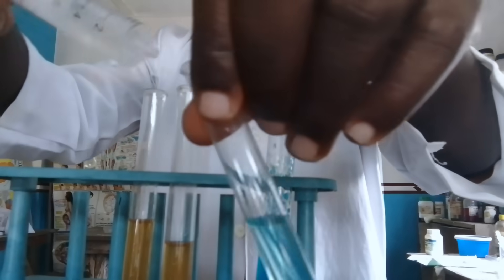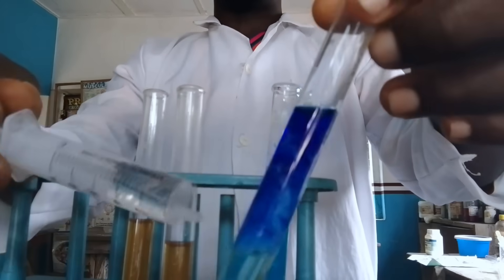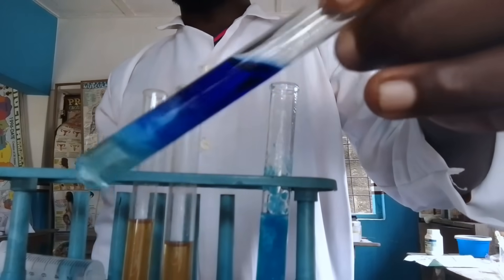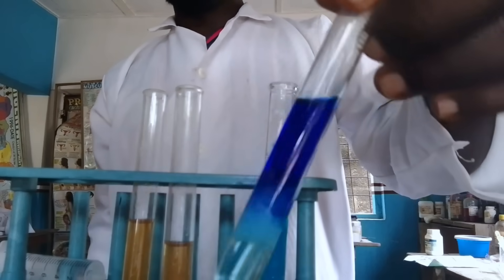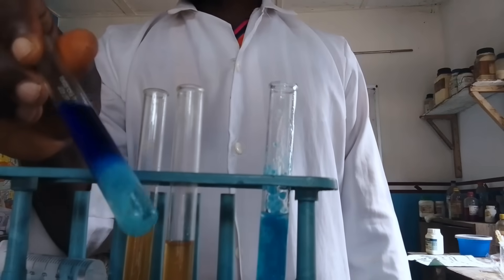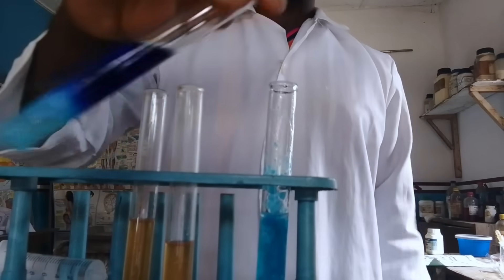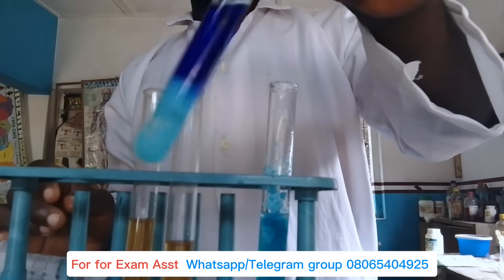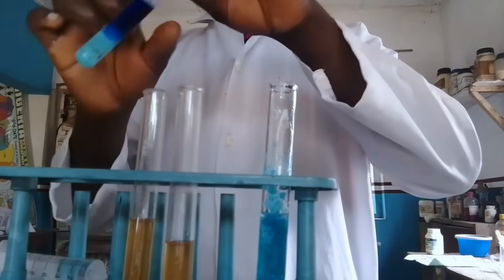Here is ammonium hydroxide. When we added ammonium hydroxide to the copper sulfate solution, this is the reaction it gave us. The observation: we can see that it has a deep blue solution — a deep blue solution is formed. The inference is: formation of tetraamine copper two ion complex.